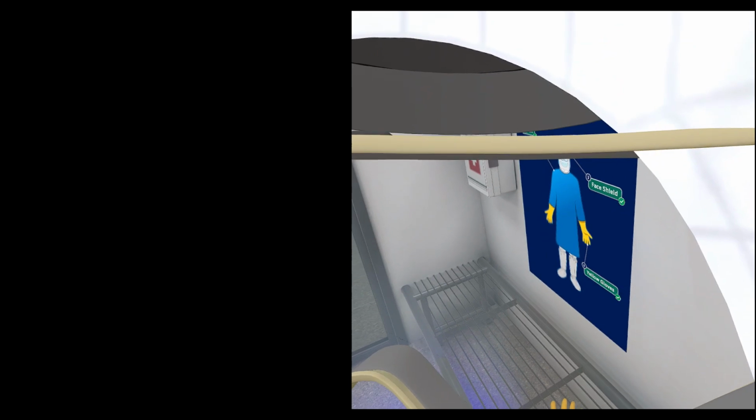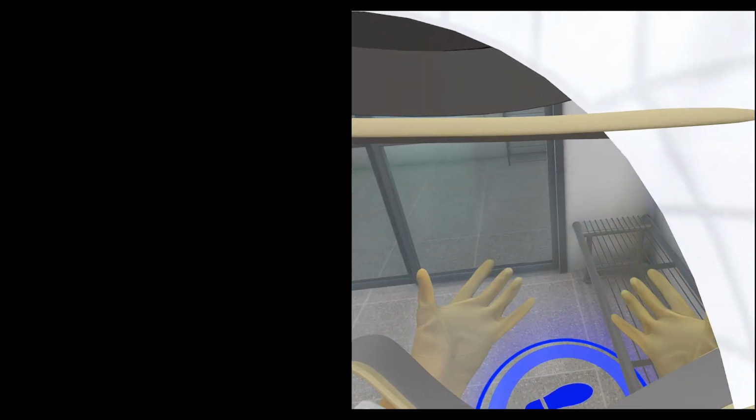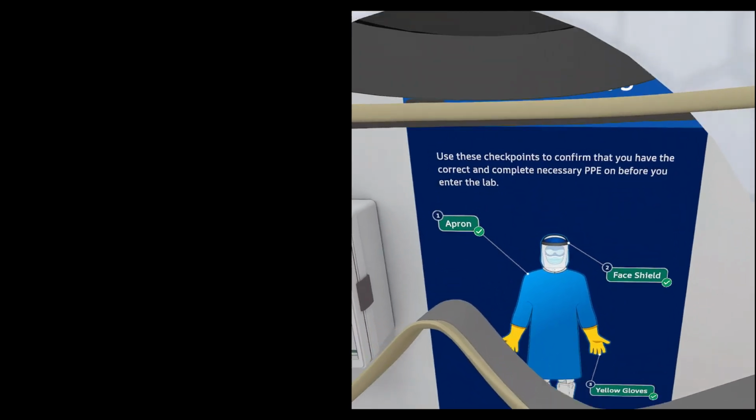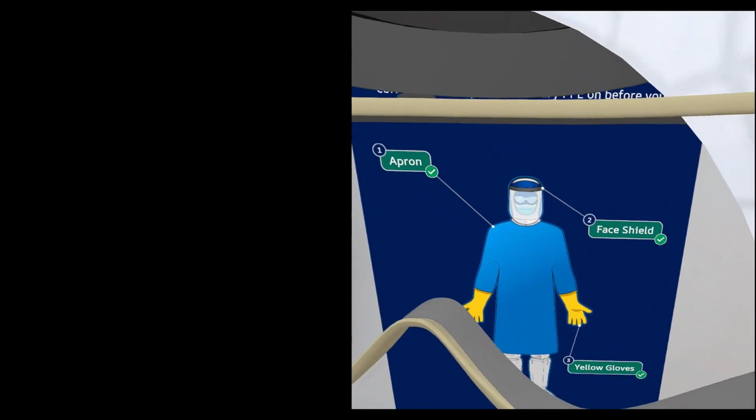Teleport to the check-in graphic on the wall and confirm that you have all the proper PPE on to work at the wet bench. Teleport to the wet bench.